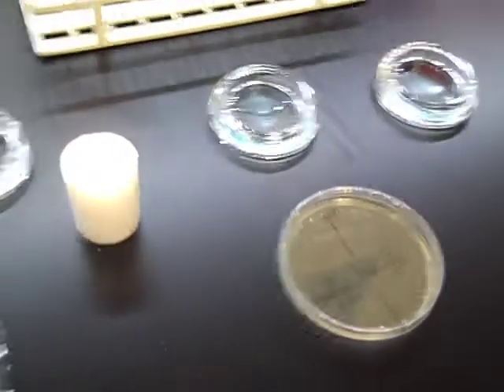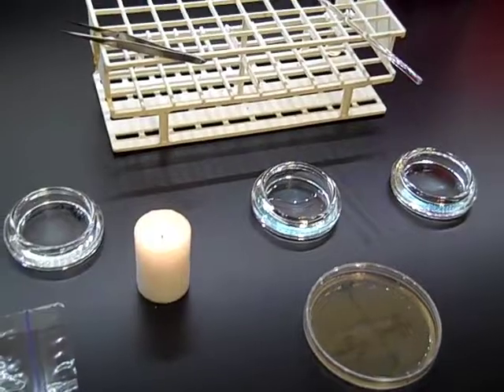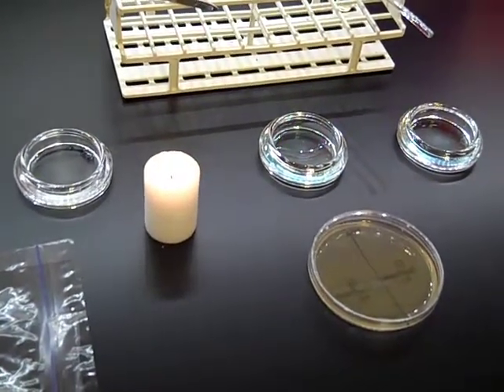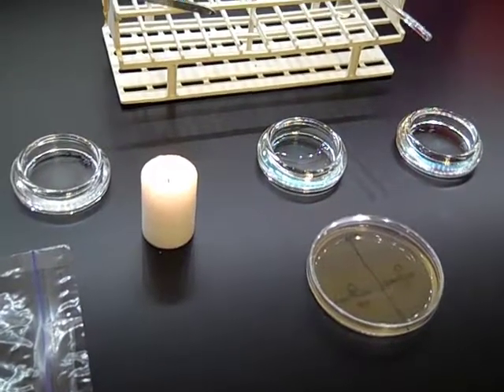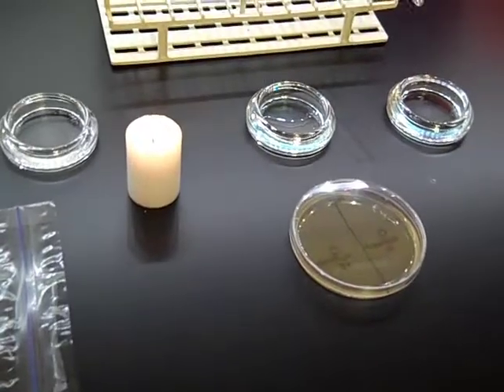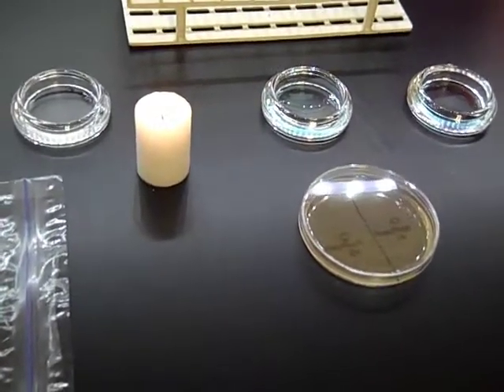You also are going to need to prepare spread plates using Staphylococcus epidermidis. Review the video on spread plate technique if you need a refresher. Now we're going to go over how to apply the disinfectants, antiseptics, and food items to your plates.